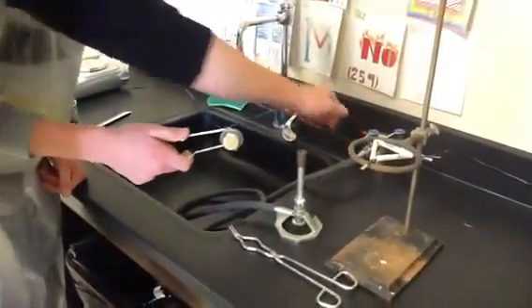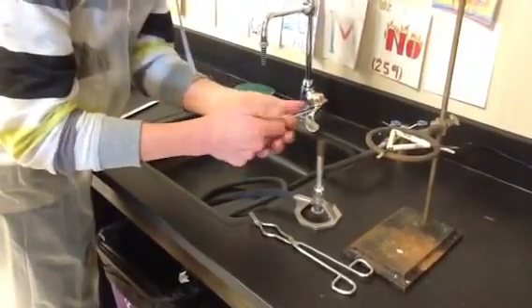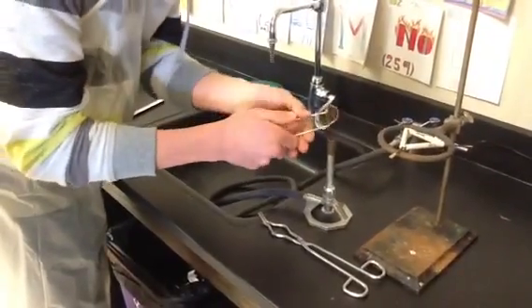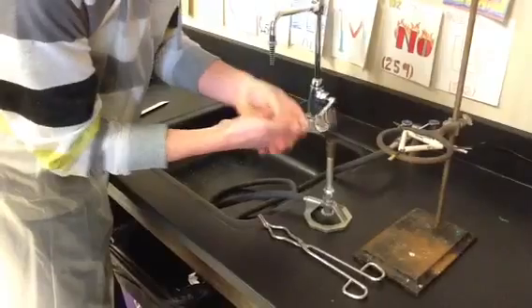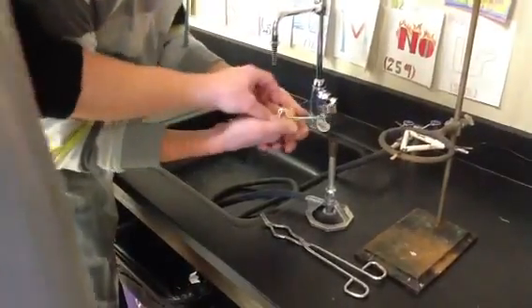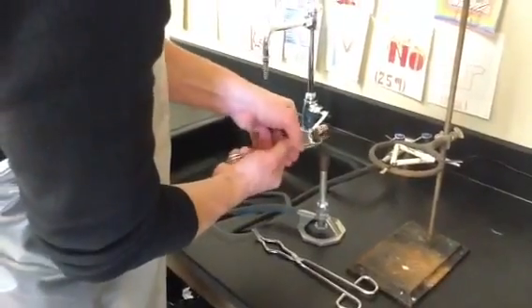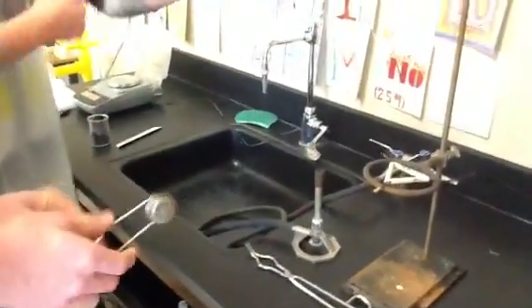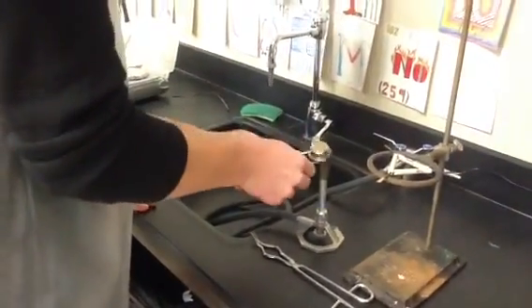We're going to start it right now. I can hear the gas flowing, that means I should start. We're going to stop and clear up the gas so it's not an explosion — that would break the camera. Get in a couple of practice ones right now.